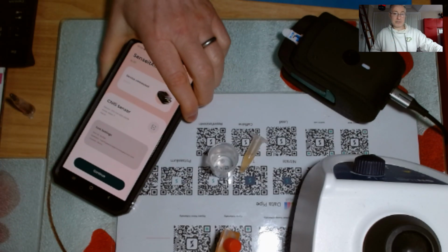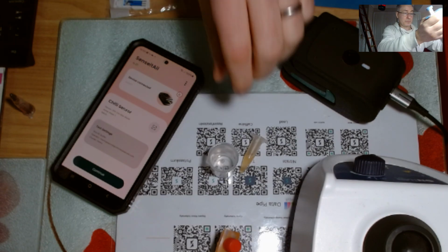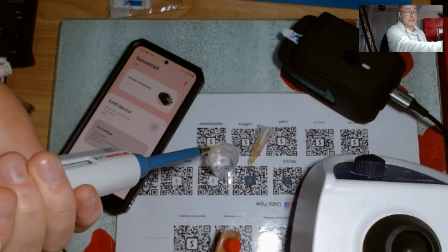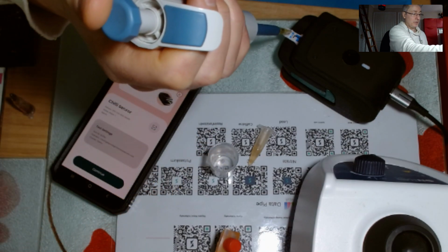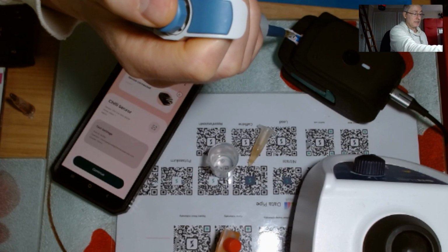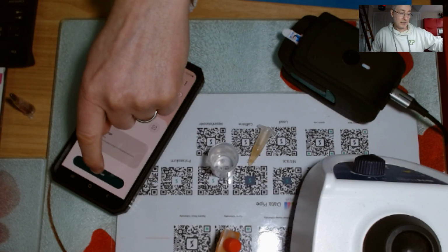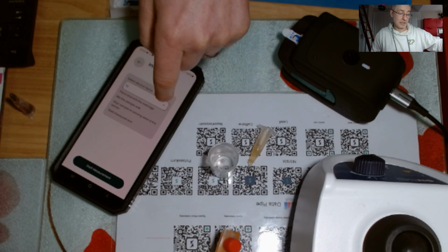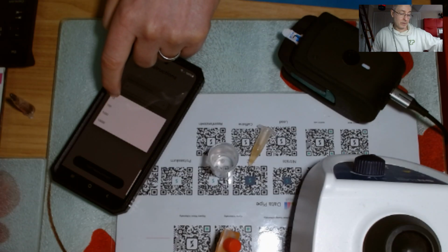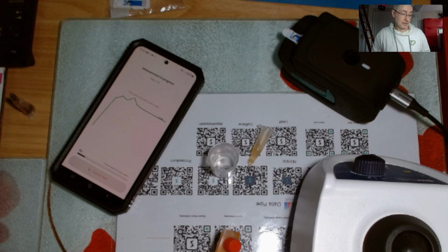I'm going to make a deliberate mistake, because this is what I think might have actually happened here. So I'm going to pretend to take my sample, but in fact I'm going to accidentally take the buffer instead. So I'll take the buffer and put it onto the sensor. Just made a mistake, I wasn't thinking, I was just going quickly. And then I'll continue. I'll make sure that I choose the 1 in 10 dilution, then start the measurement. And off it goes. And let's see what we get.